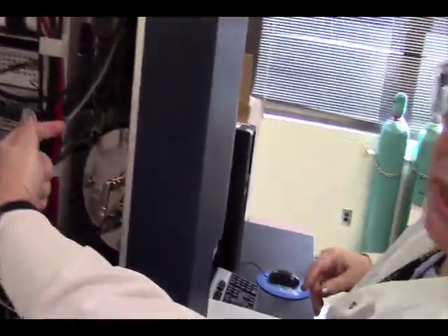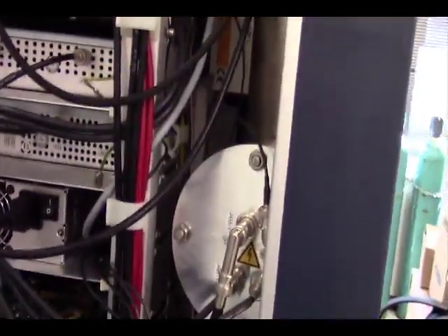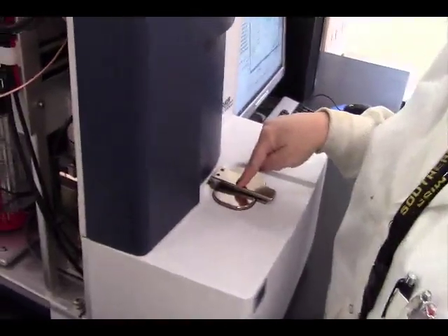So if you look in there, that's the big tube that is filled with a vacuum. Okay? If you look up there, you have detector rings up, and you probably can't see it very well with video because it's way up in the dark. Okay. So what happens is your sample goes in here. It's hit with a laser beam.